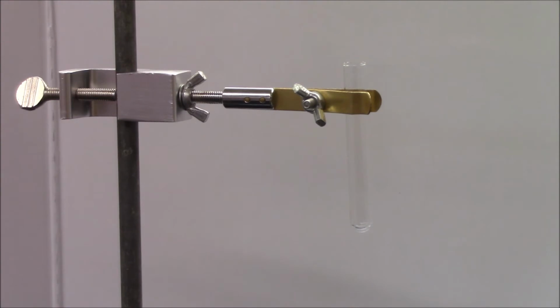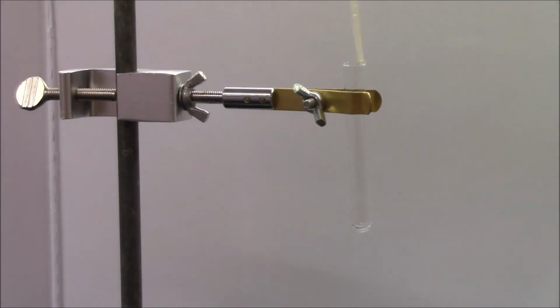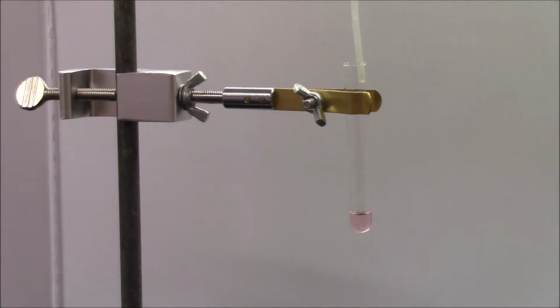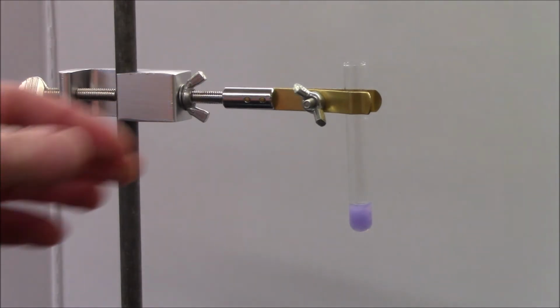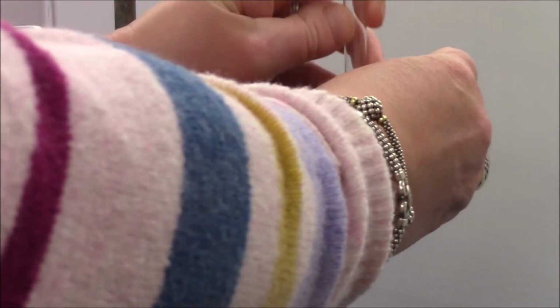Next, we have a reaction between cobalt 2 sulfate, which we have observed before as a transparent pink liquid, and sodium phosphate, which we have observed before as a transparent and clear liquid. When I add that, the solution changes color. It goes from pink to bluish purple. We can write that down. Bluish purple. Okay. Again, a color change is an indicator that a solid has formed here. That solid is blue in color.